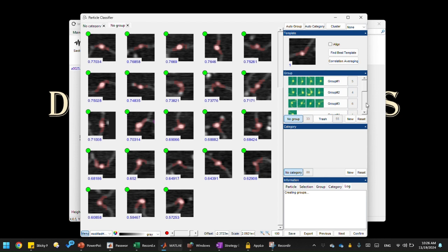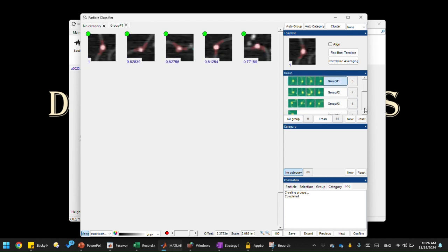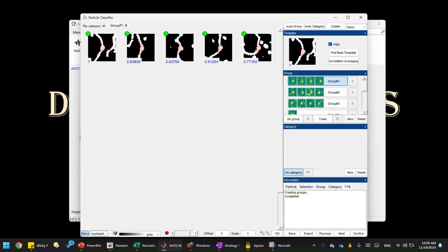It's generating 9 groups, or 9 clusters, right now. We're going to see how well it does the clustering. Start from group 1 and we just click alignment. So this is a bent state. I think that's a pretty good job. Remember, it's using the particle mask for our correlation and alignment. What you are seeing is the raw data, but essentially what's calculating in the back end is this two-dimensional binary image, using the particle mask for our calculation and alignment. So it's aligning these red masks. It's not using the raw data.